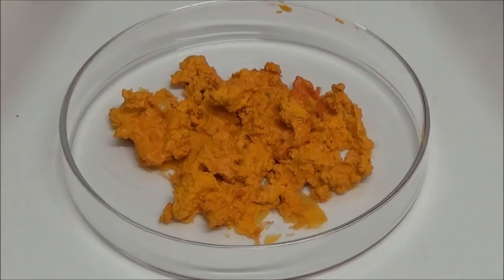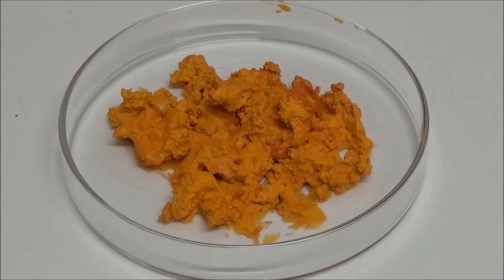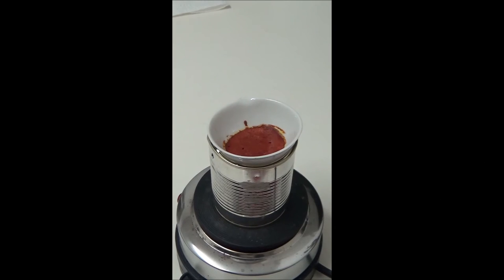The yellow residue is a stable lactone form of fluorescein, which rapidly converts to the open carboxylic acid form under standard conditions, forming stable brick red crystals. However, since our product initially began to become soupy in the residual moisture, the decision was made to use our low budget variant of a steam bath for mild drying. Unfortunately, a vacuum desiccator is not available for such purposes.